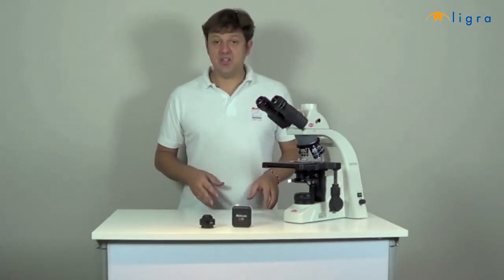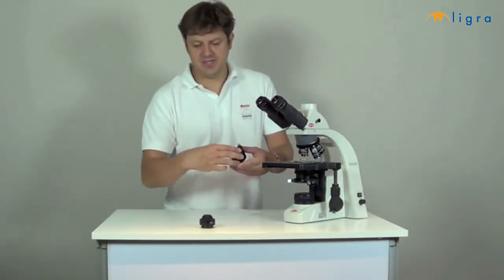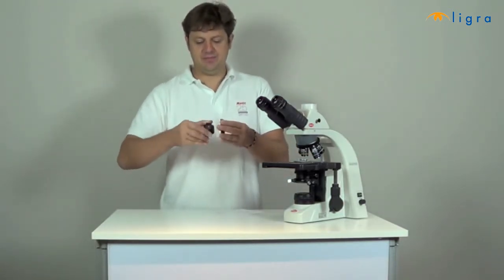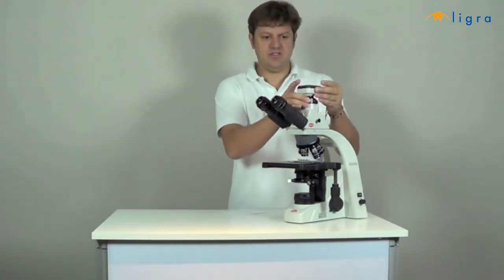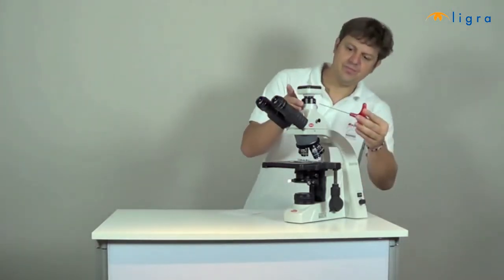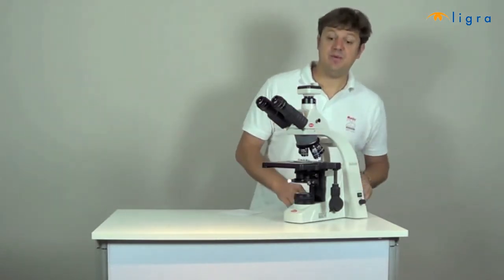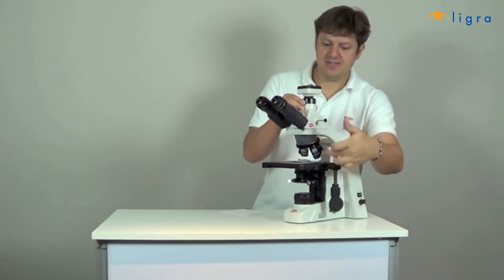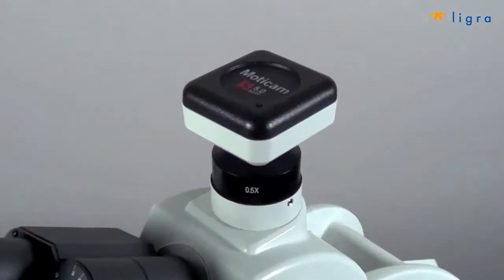If your microscope has a trinocular port, you can use the C-mount adapter. So connect your Moticam to the C-mount adapter and fix it on the trinocular port. And remember to pull out the beam splitter so that the light path is open. The C-mount adapter is different for each model of microscope, and it also depends on the sensor size of your camera. It is not included in the Moticam box.